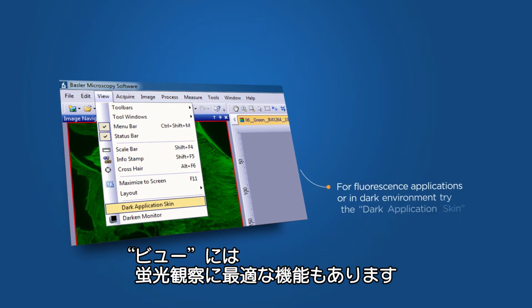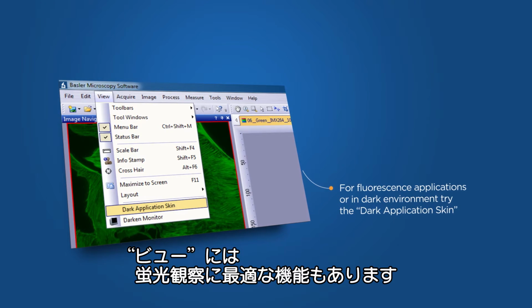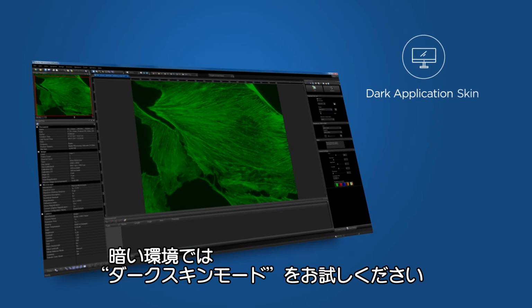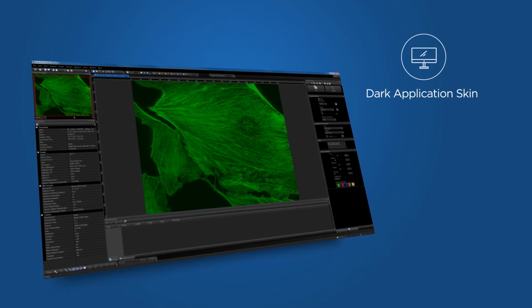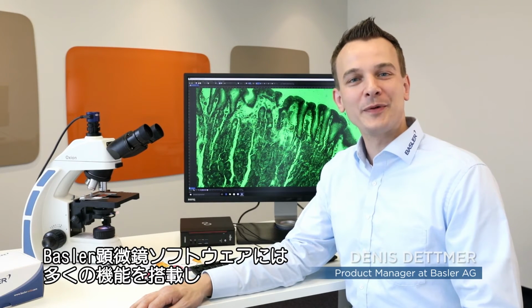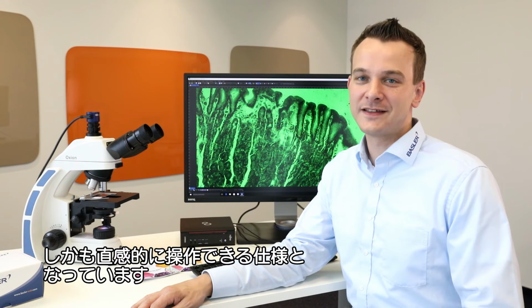There's another handy feature under the View menu, especially for fluorescence applications. When you work in a dark environment, try out the Dark Application skin. As you can see, the professional Basler microscopy software offers many features. With an intuitive user interface, it is still easy to use.